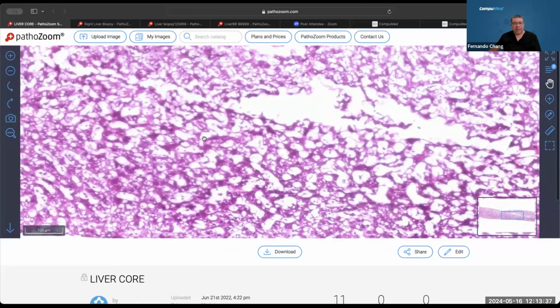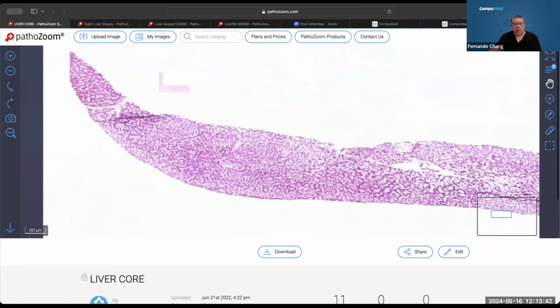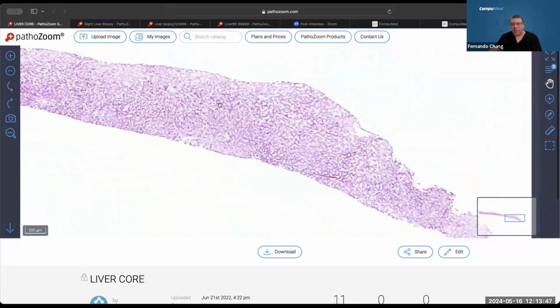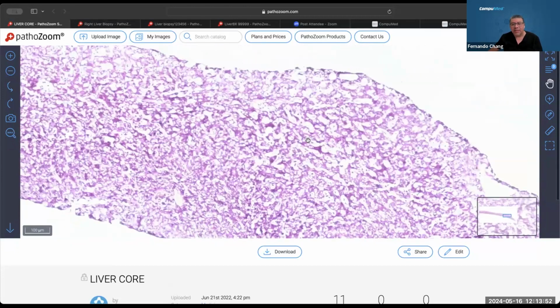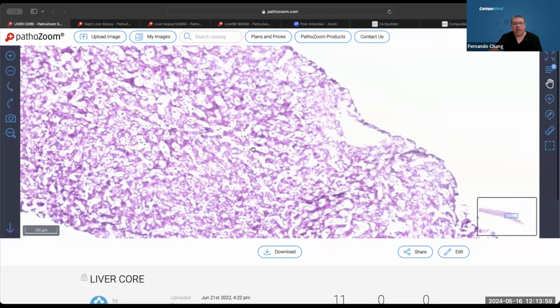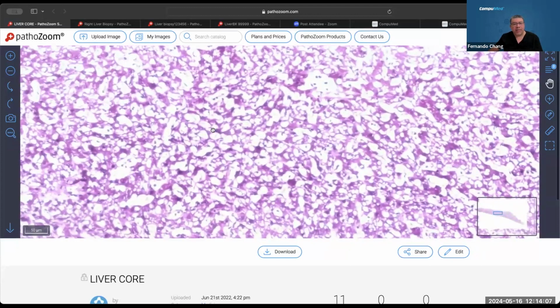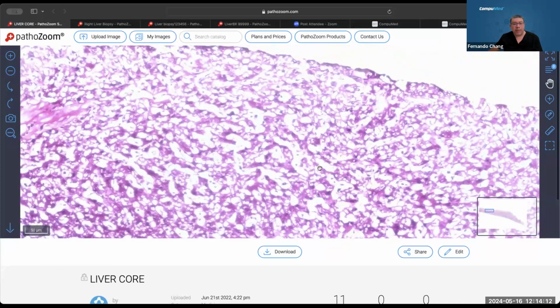Okay, thank you. So this is an example of this, really not talking about the staining. The staining looks good. I don't see any other problems with this slide, but when you zoom in and try to evaluate the morphology, you can see how extensive the freezing artifact is, in this case a compression artifact. You can see how the cells are being compressed and basically form cords all over the place, and you cannot really see that. There is steatosis, yes, for sure, but we also can see some bubbling here as well.